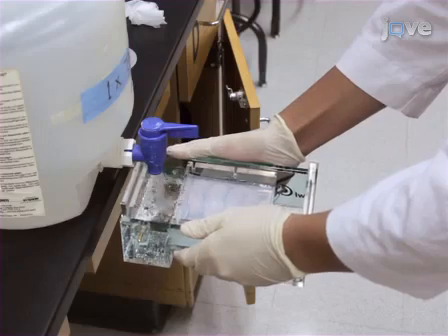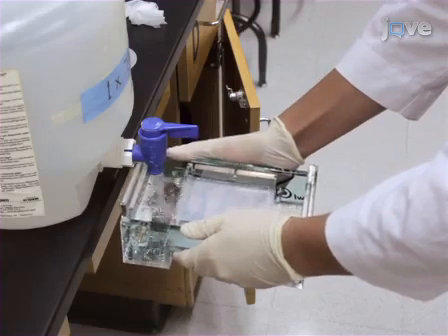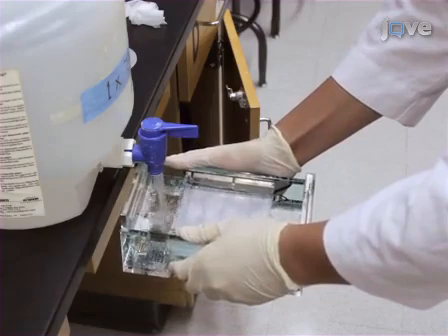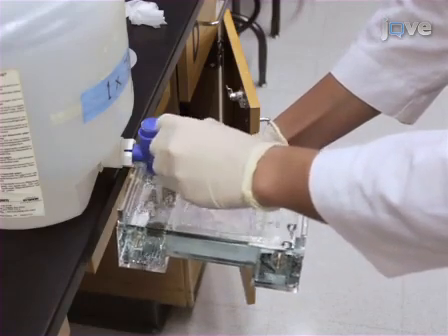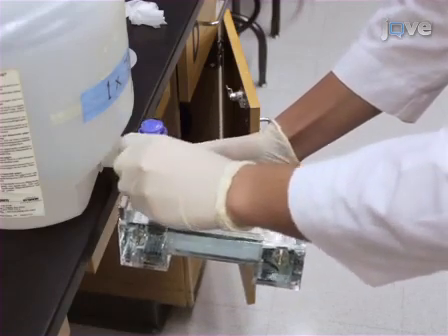Now add enough running buffer into the gel box to cover the surface of the gel. It is important to use the same running buffer as the one used to prepare the gel.